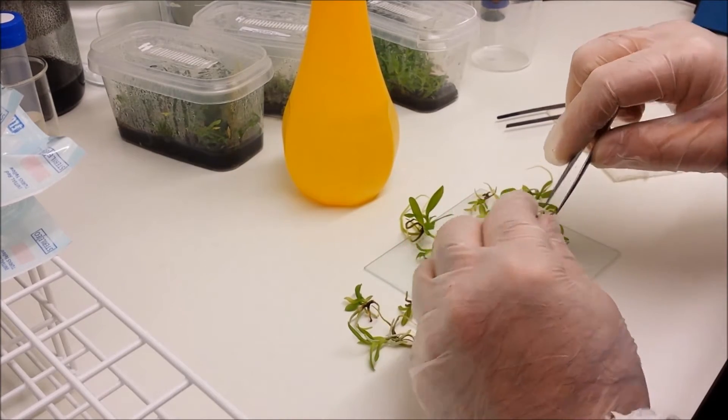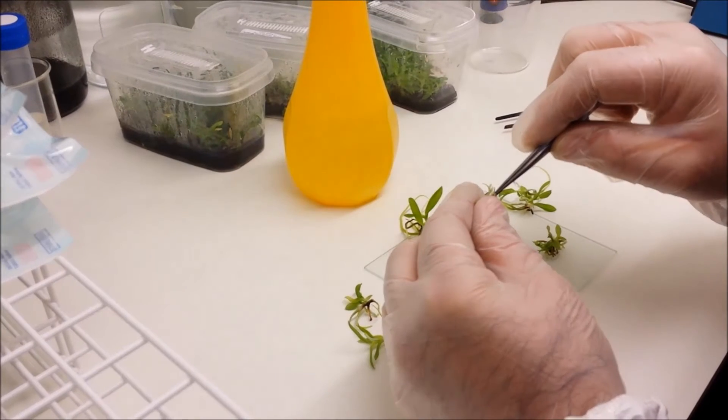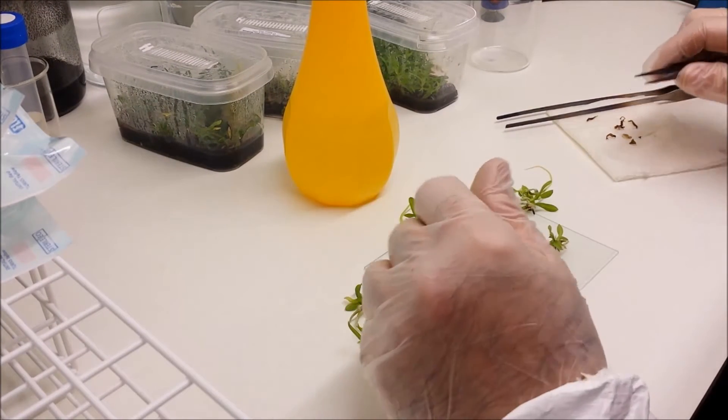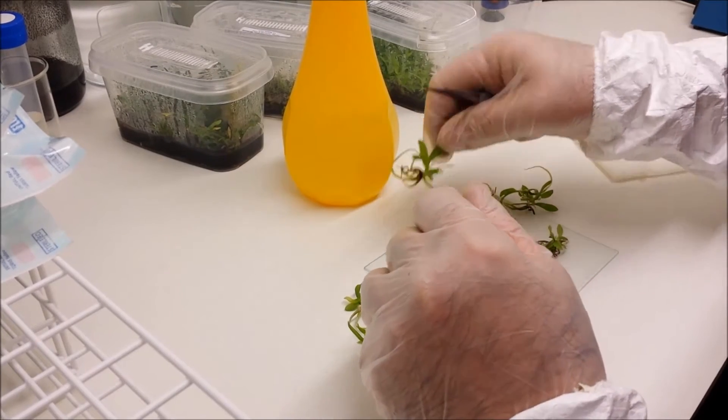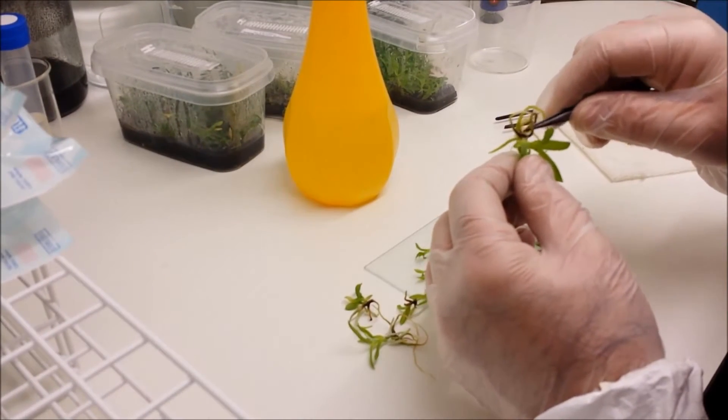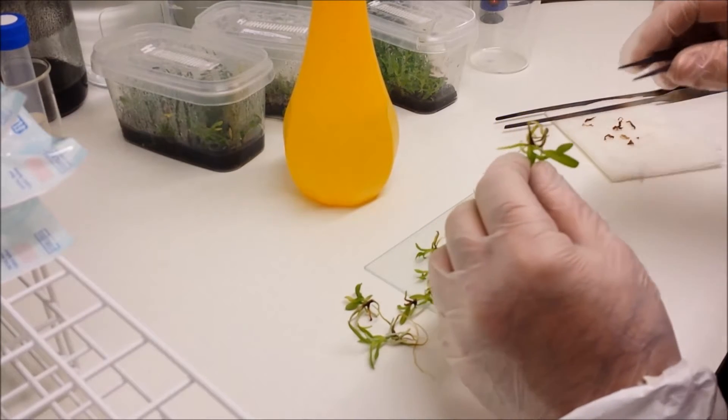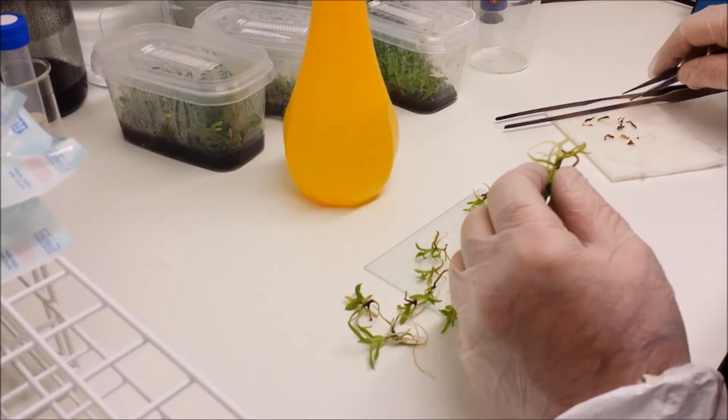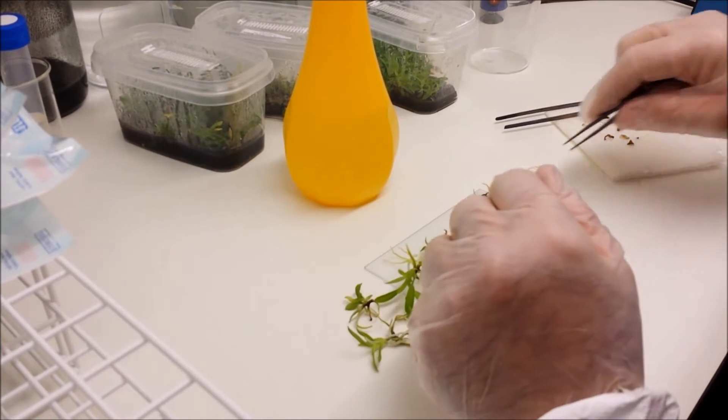Now I've done a similar video to this previously. So I think this is probably the last one of these I'm going to be doing because effectively the process is the same regardless of what the species or variety of plant is. It's just the same process. It could be a Phalaenopsis, it could be a Cattleya, it could be a Cymbidium, it could be anything really. It's the same process and it's the same principle.